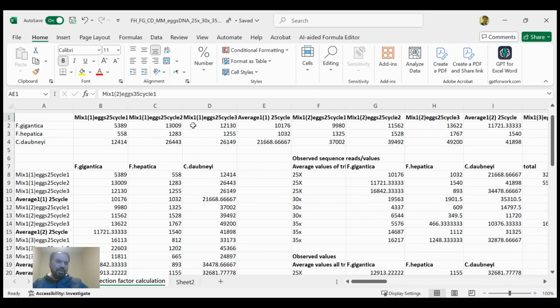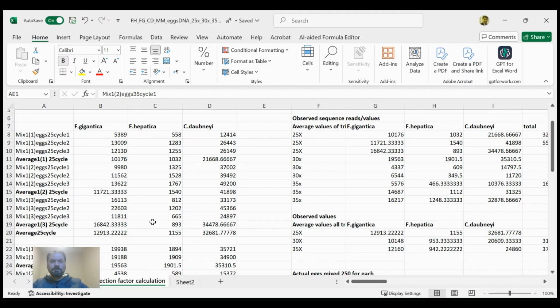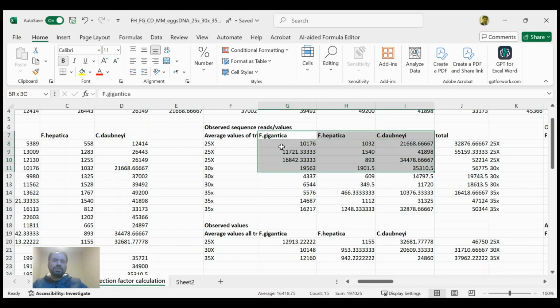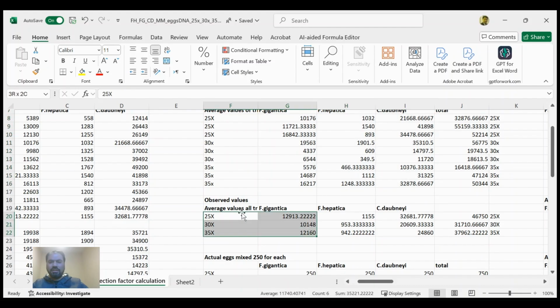And then I have copied and pasted all of this column-wise. Here you can see, and then further sorting out this data in the form of average values, we have now taken only the average values of the 25x, 30x, and 35x average reads. Here you can see in each column, these are the observed sequence reads that we got from the MiSeq run. And in the next column, we have taken the overall averages of reads from all three species.